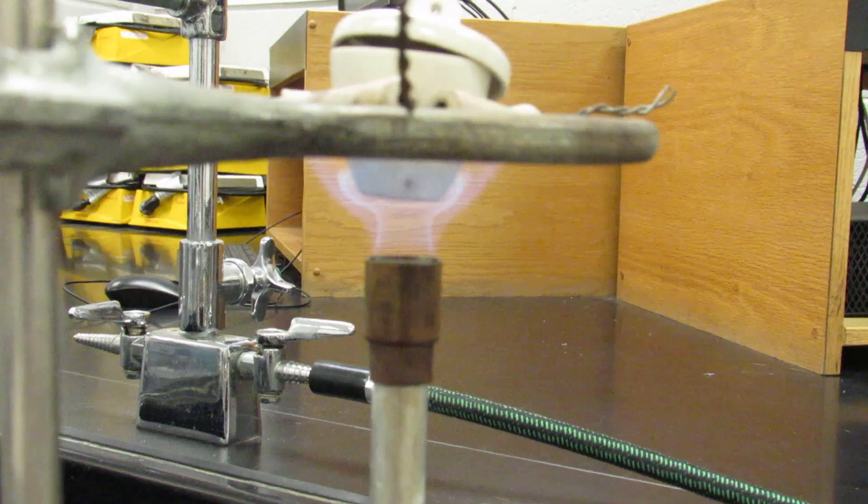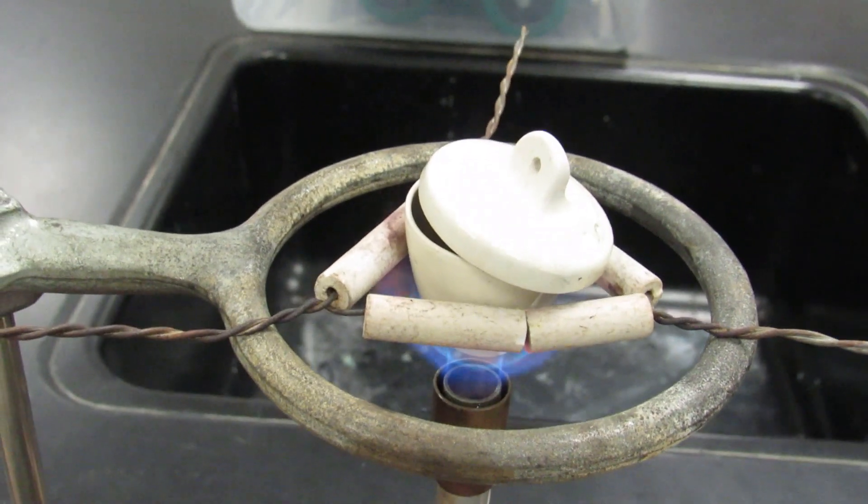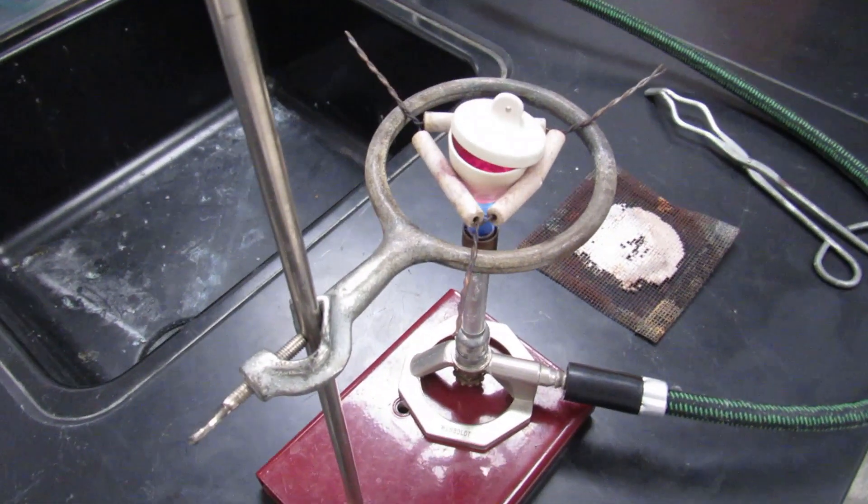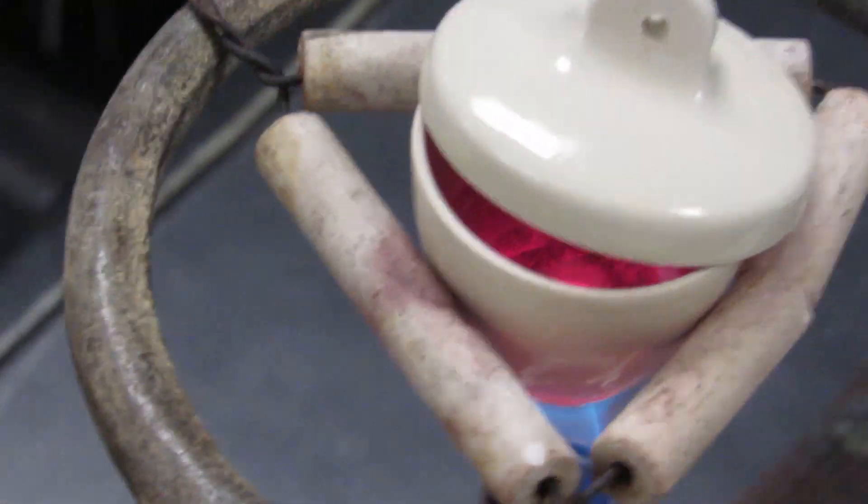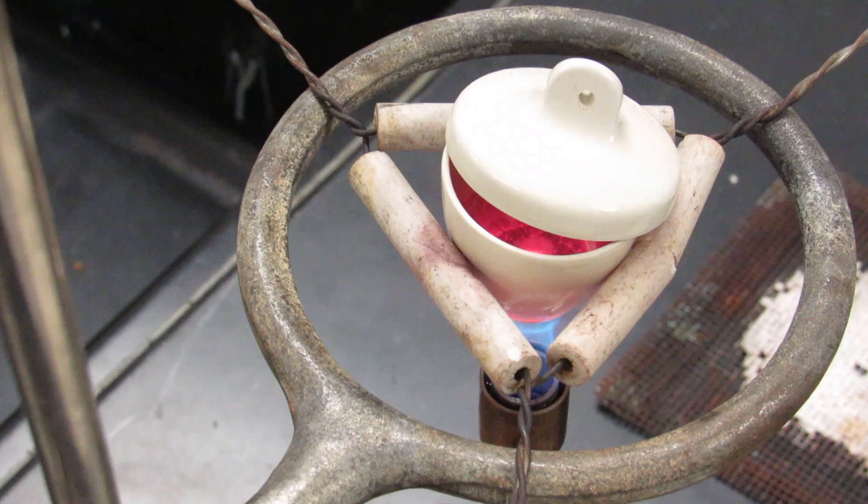And leave it like that, monitoring the flame. After about five or ten minutes, if you look inside, it should have a red glow. A really orange glow that tells you that the reaction is taking place.